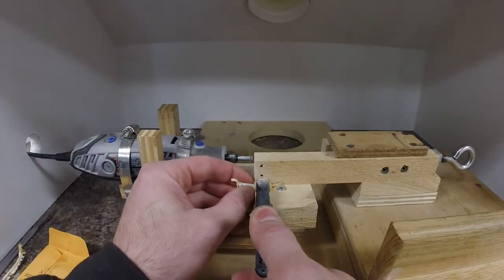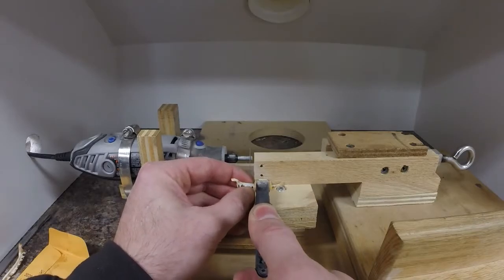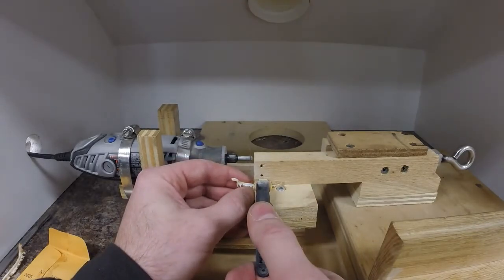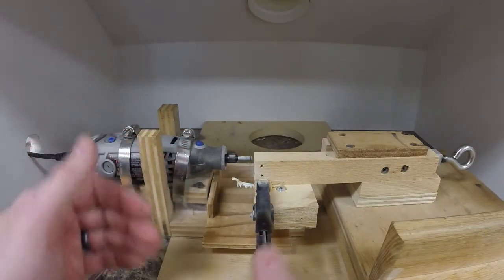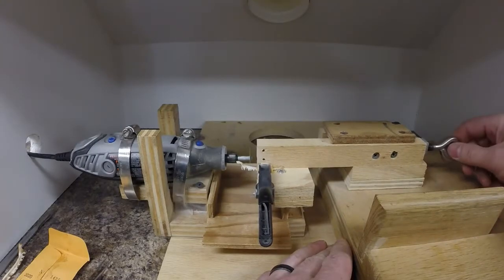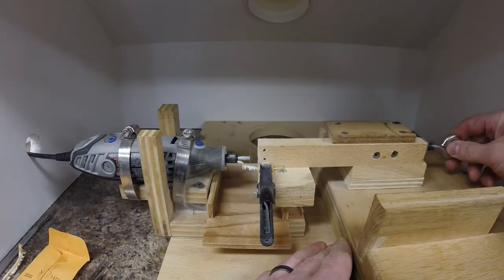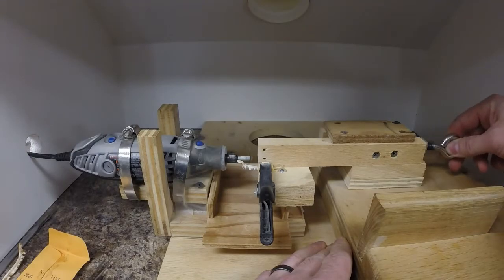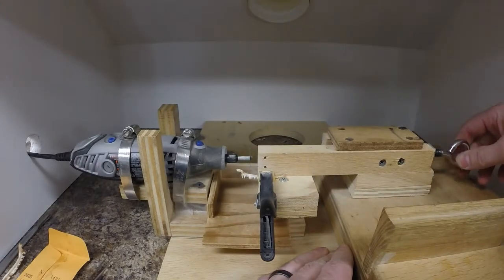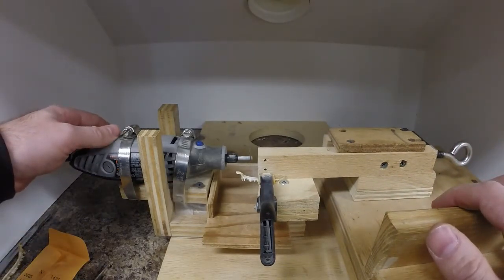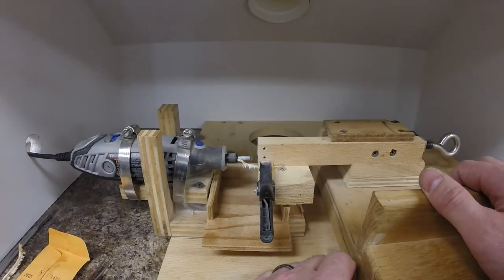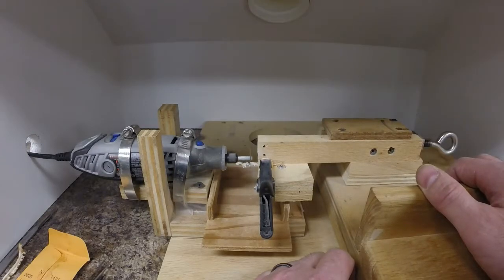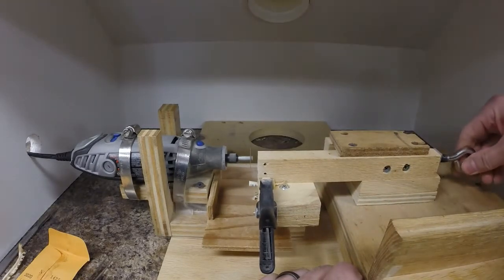So to section this one, I clamp it in, leaving enough out so there's enough space to take all of my sections. We want to make sure it's as perpendicular as possible to the blade, so I want that maxilla to be straight out. Adjust for my first cut. So cut it off as close as I can to the knuckle. For this first cut, I'll leave the dust collector off just so you can still hear me talk. Then I'll turn it on.